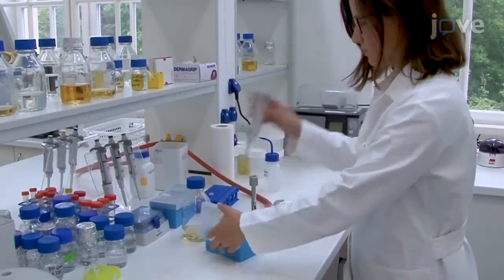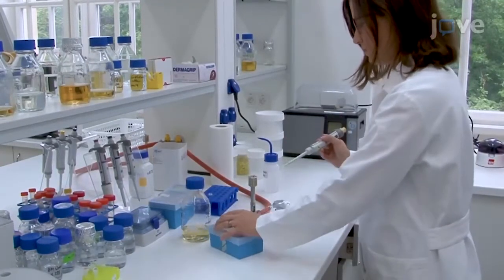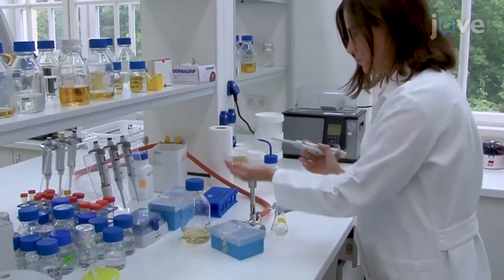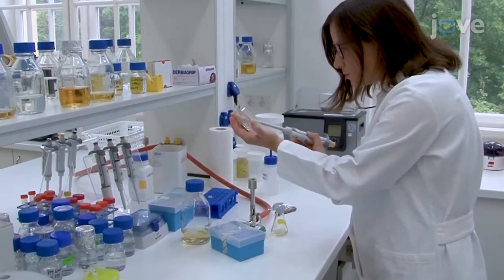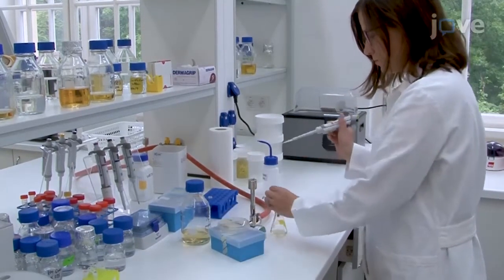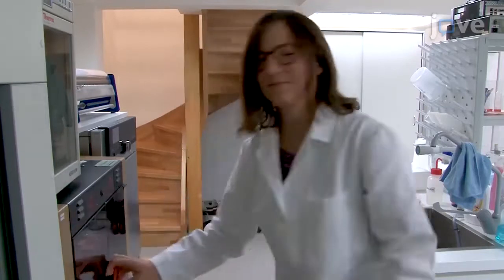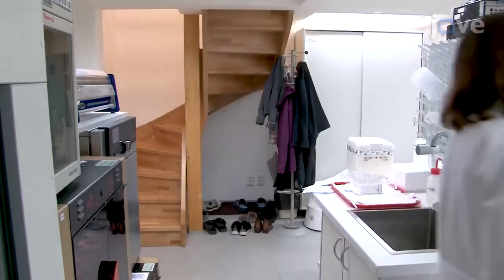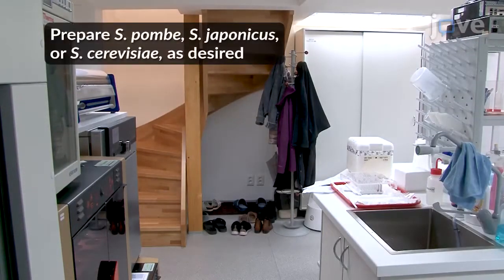To begin, follow along in the accompanying text protocol to prepare the staining solutions, culture media, and cells. Ensure that the cells are healthy and in the desired growth phase prior to running the experiment.